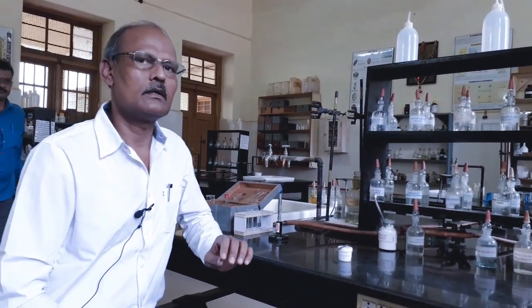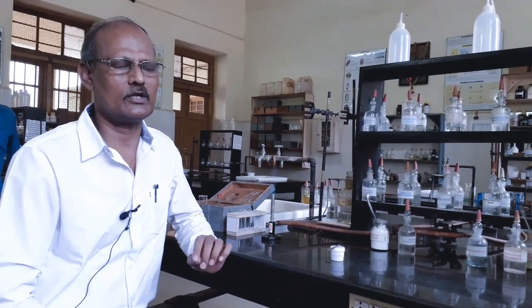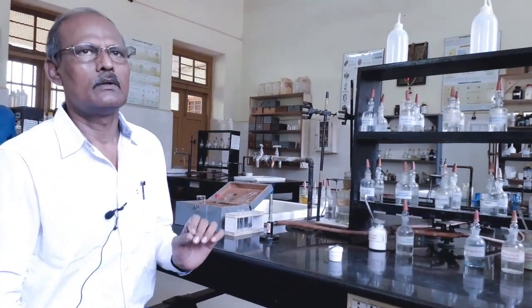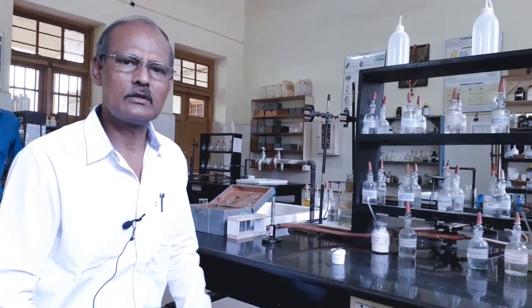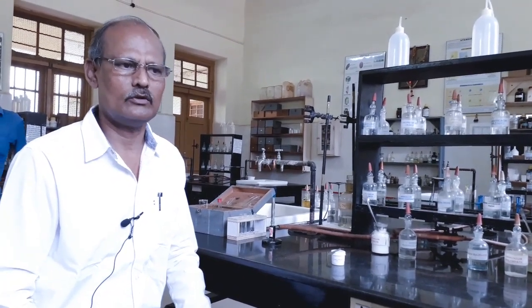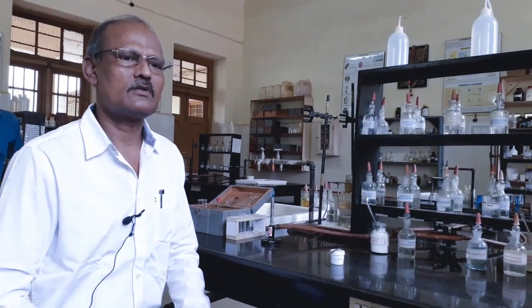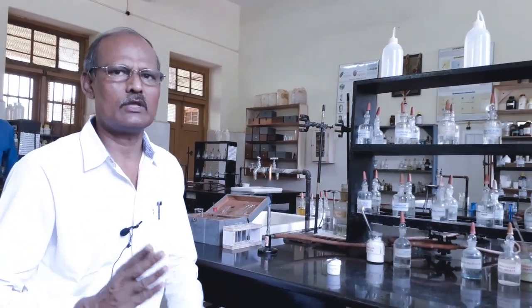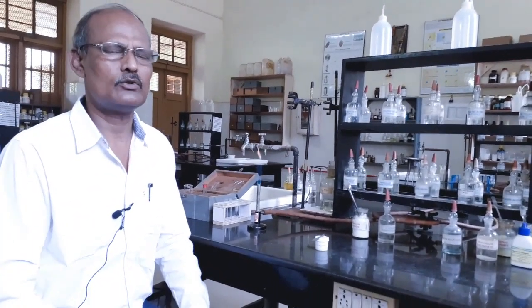They are detected by taking the original solution. The original solution is a solution in which the salt is soluble in a suitable solvent. The solvents are selected in order: first water, next dilute hydrochloric acid, finally dilute nitric acid.